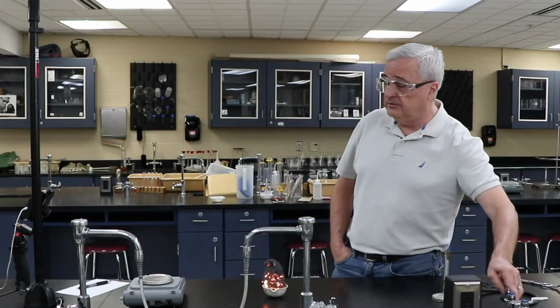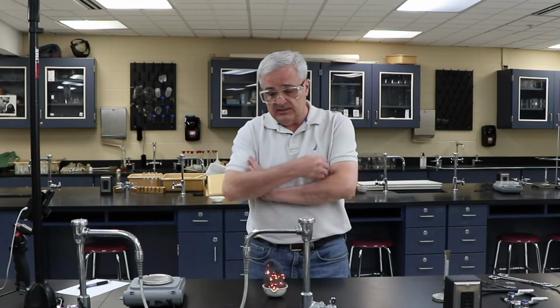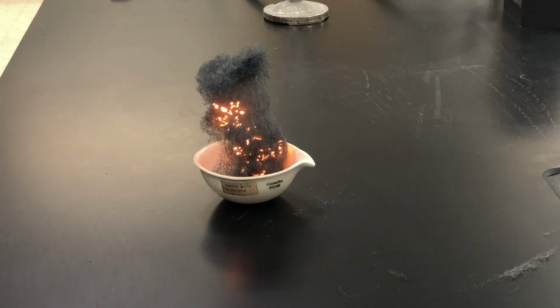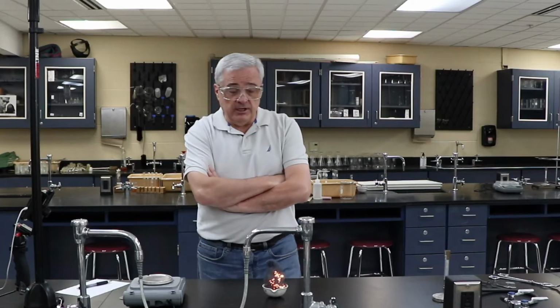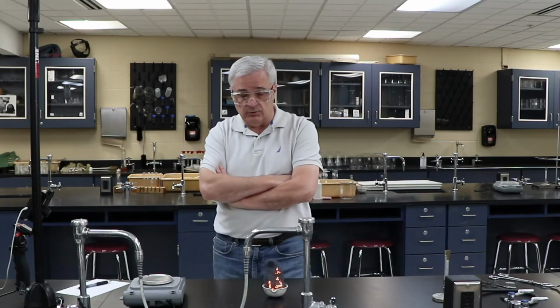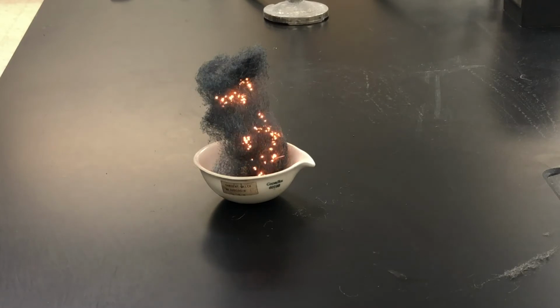Turn the Bunsen burner off. Being careful not to reach across it with my hand and set myself on fire. Because I fluffed it out, there's enough air to get in, and we have the burning of the steel wool. The first thing we're going to notice is that it's changing color. We'll talk about that a little bit in the results section, more in the discussion section. So there you have steel wool burning. You can also ignite it with a 9-volt battery that's sometimes very dramatic.